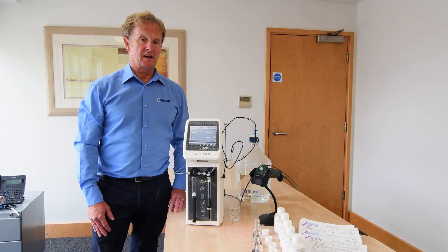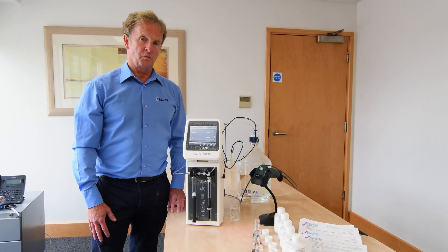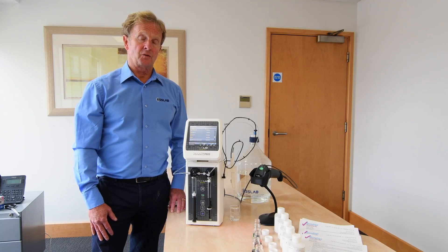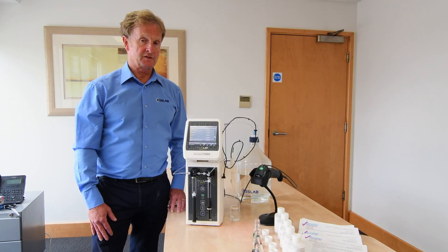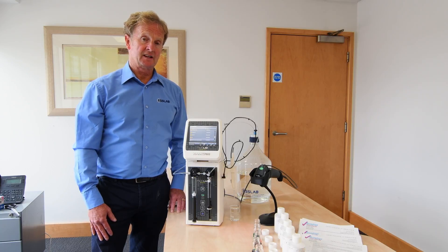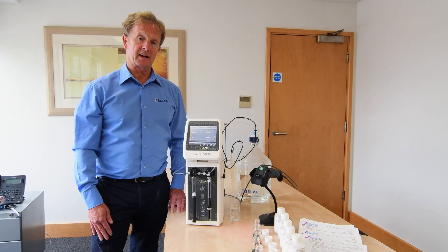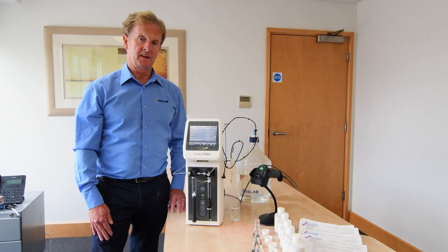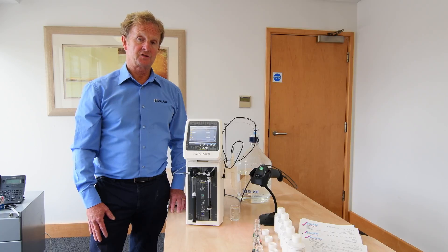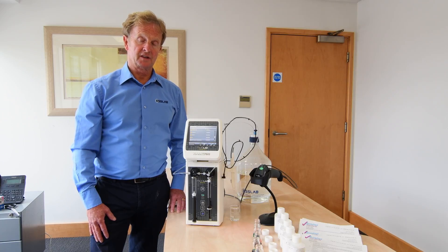First we'll look at the wizard function and then afterwards we'll look at some custom program functions. We're saving the wizard program into our custom menu, where we can add additional instructional text describing what the operator should do next. This allows us to follow a workflow from your SOPs, and we'll also show the use of the barcode reader to input the ID of each standard, giving traceability back to the original CRM manufacturer's lot and batch.